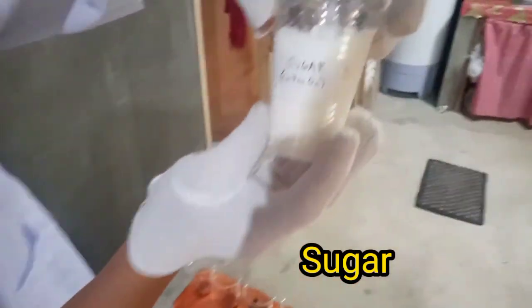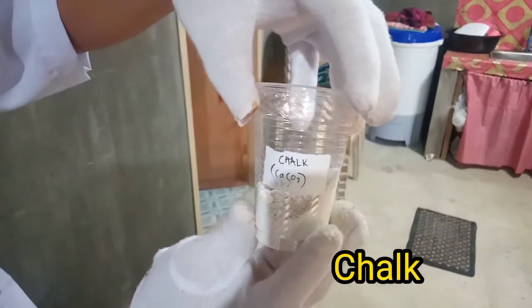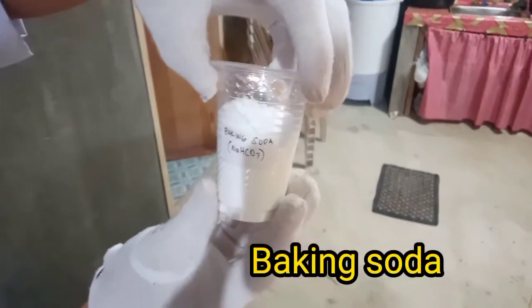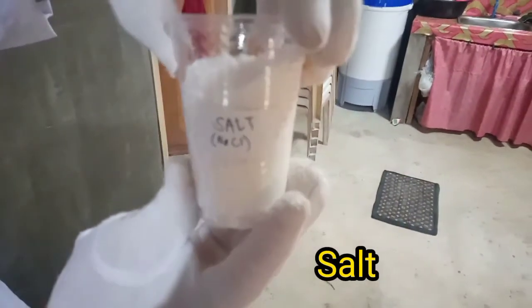The sugar or C12H22O11. Our chalk or the CaCO3. The next one is the cornstarch or the amylopectin or amylose. The baking soda or NaHCO3. And this one is our salt or NaCl.